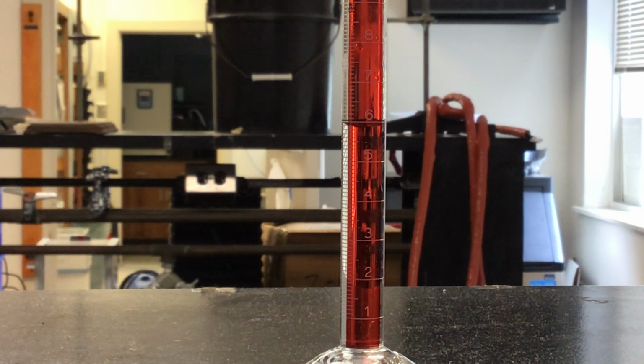There's a difference when you give that extra decimal place, to tell someone else how precise that measurement actually is. If you say it's 5.9 milliliters, well, that means it could be 5.7, or it could be 5.8, or it could be 6.0. But looking at this graduated cylinder, we know it's not above 6, and we know it's definitely not below 5.8. So it's got to be around 5.9. We could say 5.90. Now we're assuming that estimation or uncertainty in that very last decimal may vary a little bit, but that means maybe the actual value is between like 5.86 and 5.92, somewhere in that range.